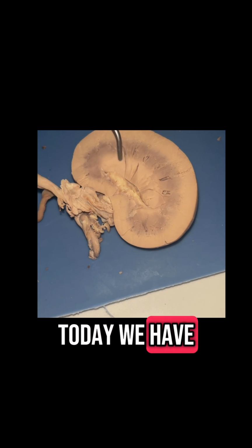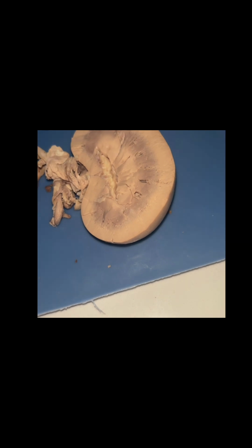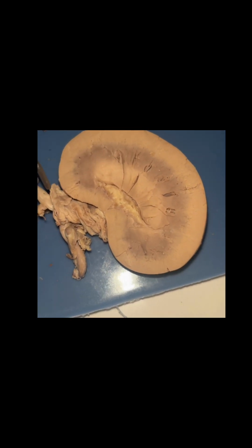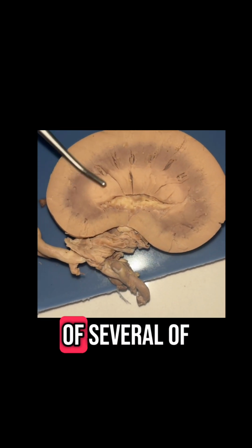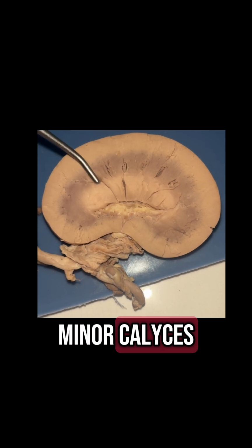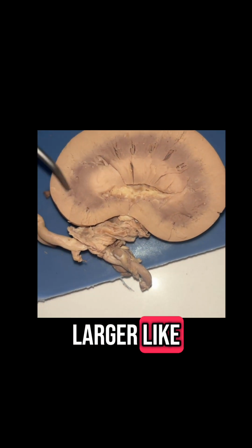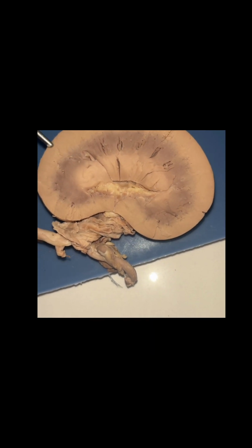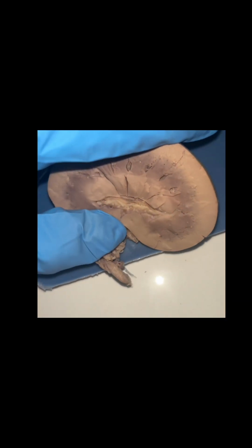And then last but not least, today we have the major calyx. It's right here. So this is going to be the larger one of the two, and it's going to be a binding of several minor calyxes, which is what's going to form the major calyx. And it serves as a larger area for collection of urine, and this is going to channel the urine towards the renal pelvis that I pointed out earlier. And that is all.